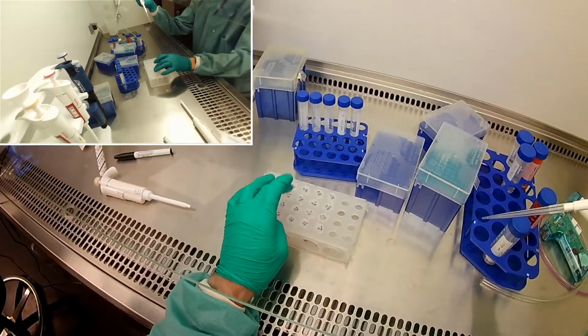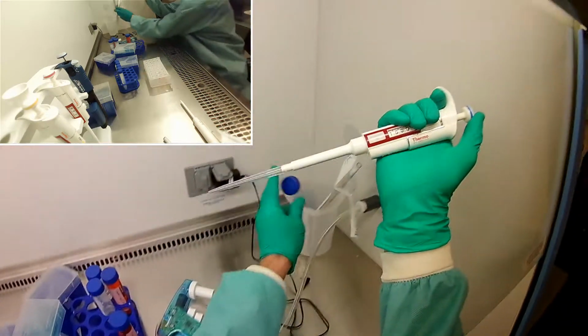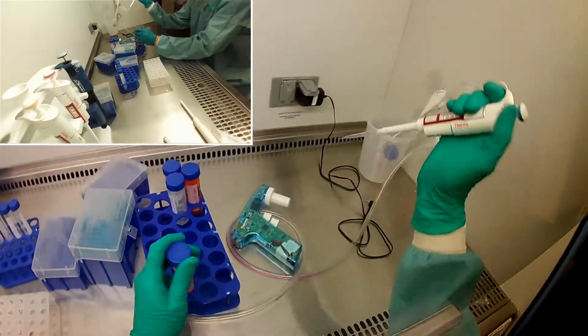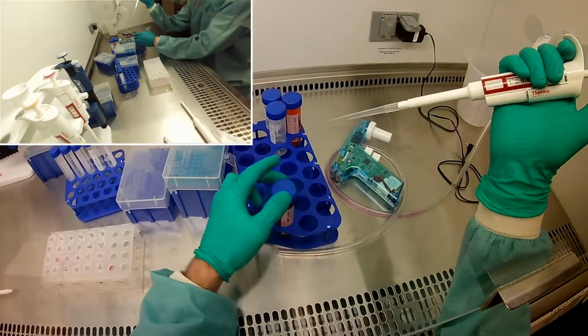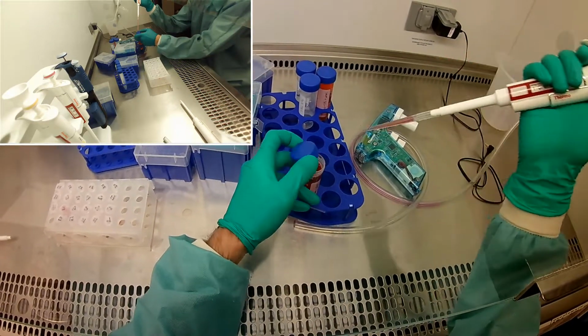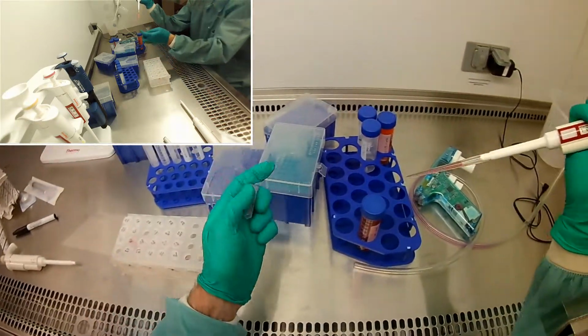I'm going to go ahead and do the same thing with the bleach ones as well. I haven't messed up this tip yet. Since it's a new thing, I might as well get a new tip, just in case. No harm. So this is where I want to do the 4% and down.